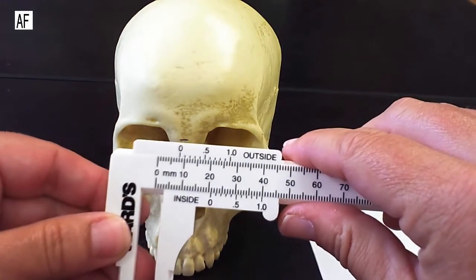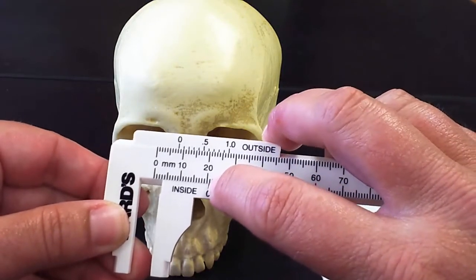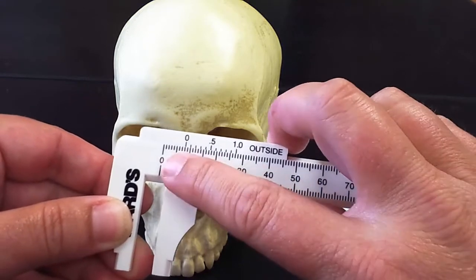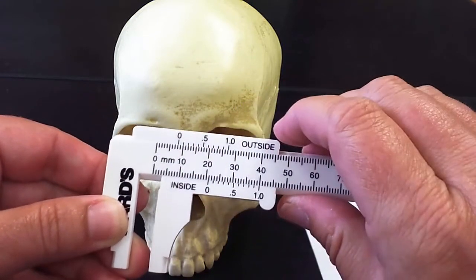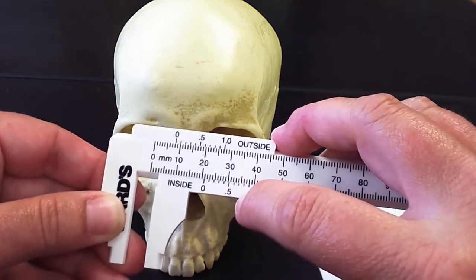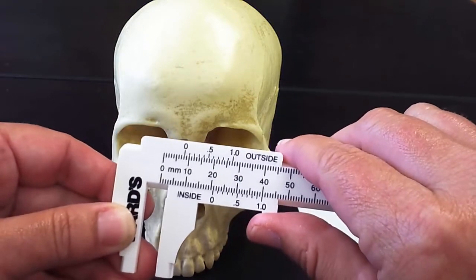I would actually say this would be 21 millimeters. So I'm reading the bottom line here, the 20, and my 0 is almost to the 1. As you can see here, the units are millimeters. So we're going to use millimeters for this. And again, don't worry about these other hash marks on the bottom of the caliper. We're just going to use the 0 for our purposes in this activity.